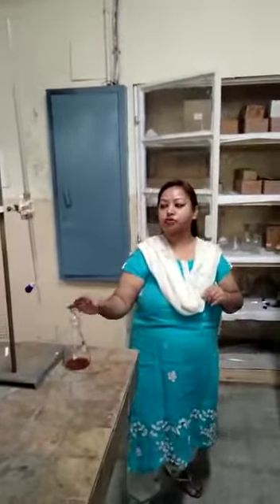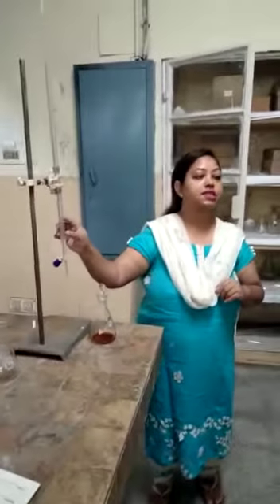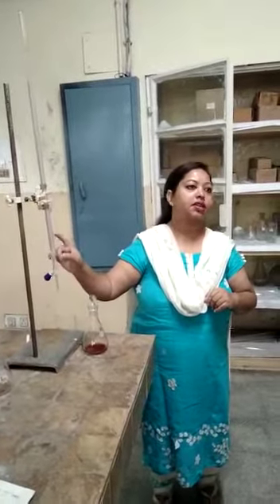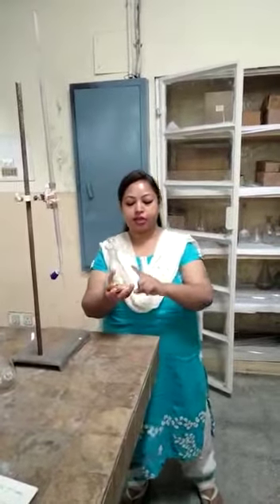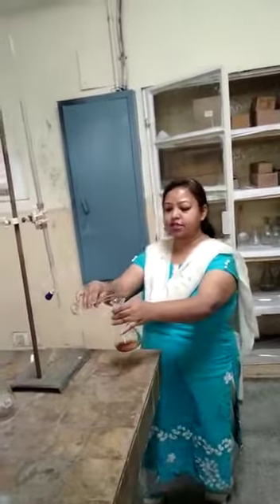Good afternoon students. Today we will do the titration of iodine with sodium thiosulfate. In the burette, we have taken sodium thiosulfate because it is a standard titrant — the normality of it is already known. Titrant is always taken in the burette. In this iodine flask, we have added iodine and potassium iodide. We will add glacial acetic acid to provide the acidic medium, and we will add some water.